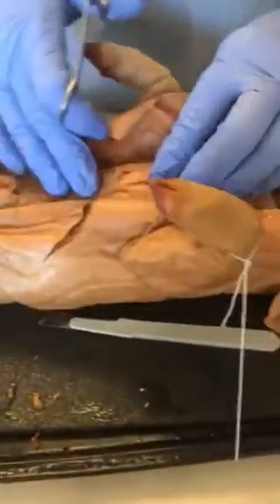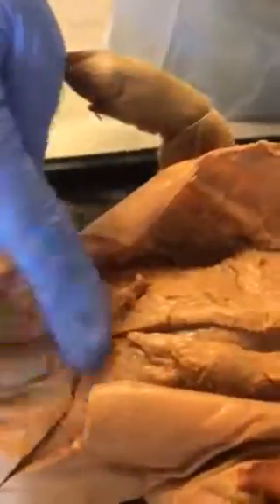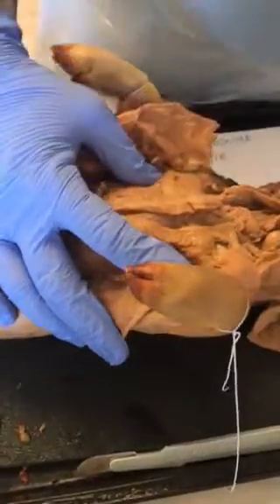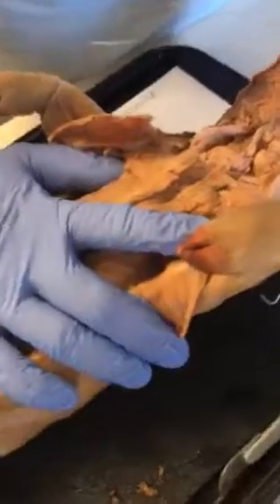Okay, so now we're down to the muscle tissue here. And I can feel the sternum of the pig here. We made our incision. So we have our incision 3, 1, and 2. Okay, so the next step says make incision 1, we got that. Make incision 2, use the tissue forceps, straight probe, and scissors to separate the muscle tissue from the sternum and rib cage. Okay, so now we're gonna separate muscle tissue from the rib cage.